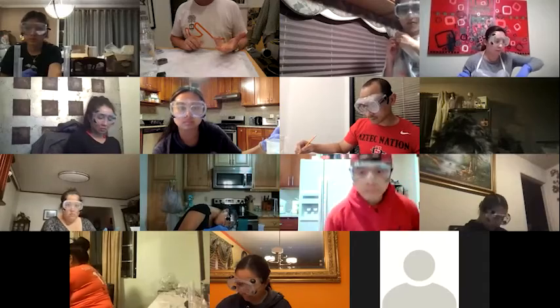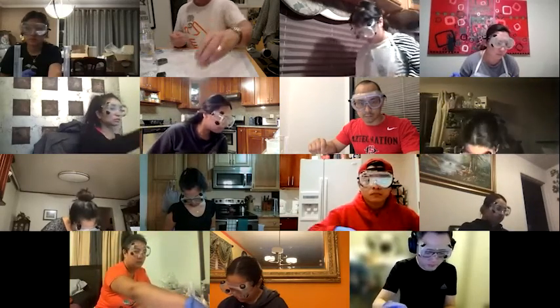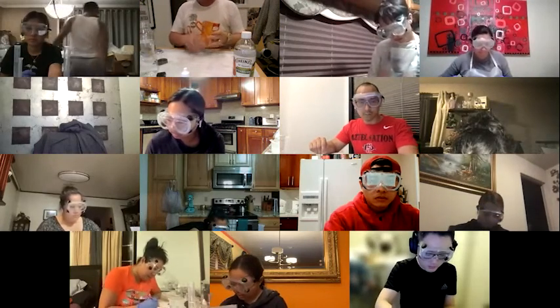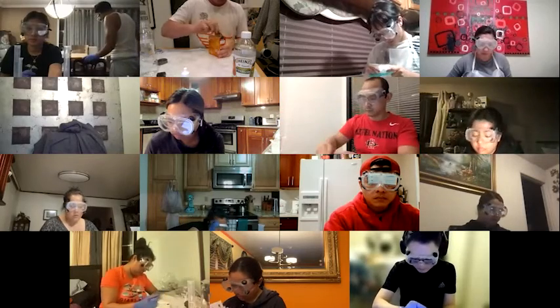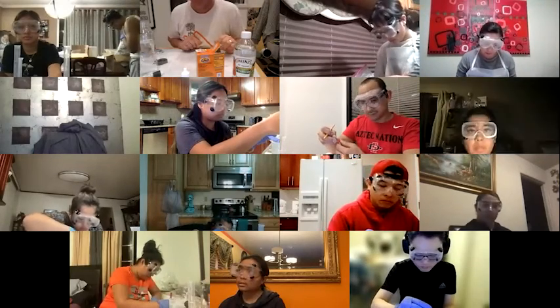So I'm going to try and set up the lime water experiment. You guys can work on the other ones while I'm doing that. I have to make sure I have all the stuff. Lime water. Got my vinegar. Got my baking soda. Actually, this thing might take till like 9 o'clock to completely fill. It is super slow. But you can still clearly see that there's a reaction taking place. I mean, bubbles are forming, just not particularly quickly.